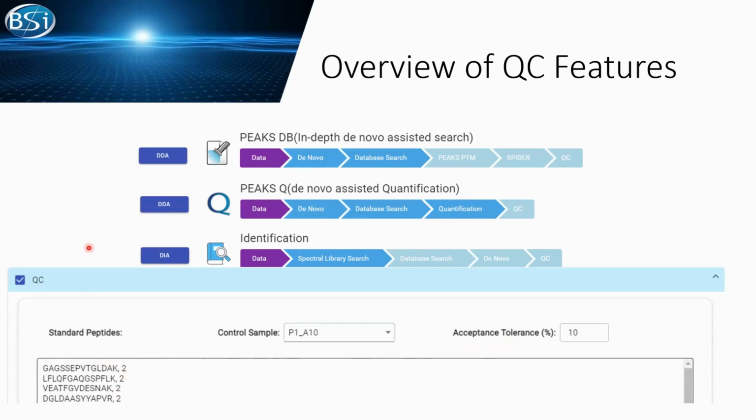So here is the setup, and I would like to take you through the QC feature in PEAKS Online, so you can have an idea about how we choose to organize data and how we're going to analyze data.